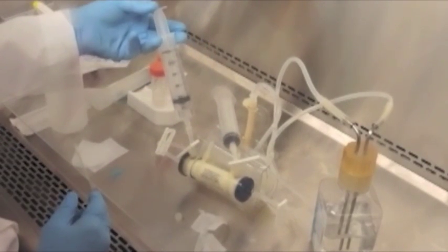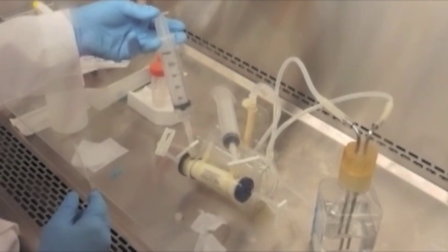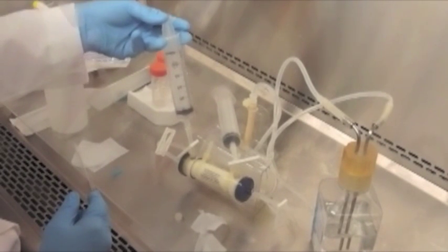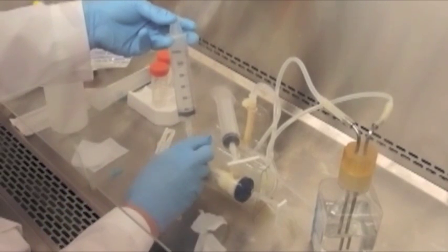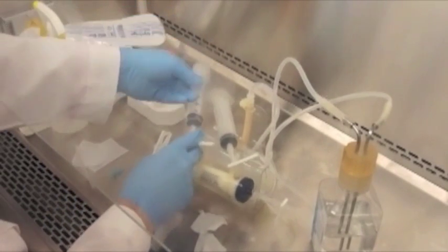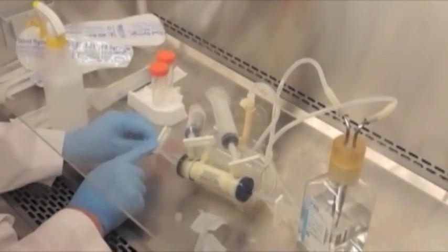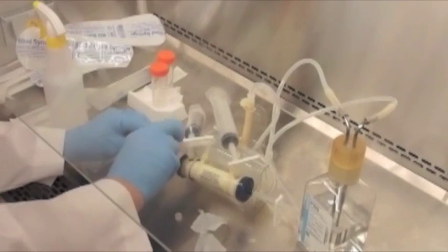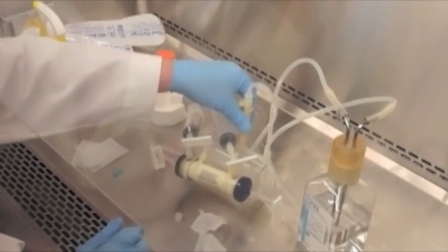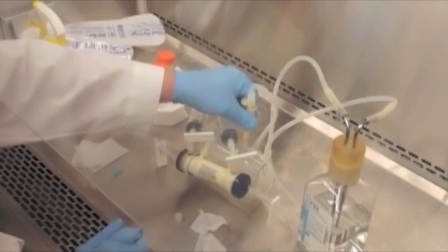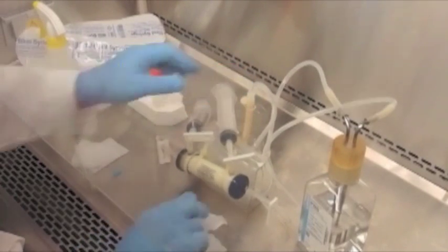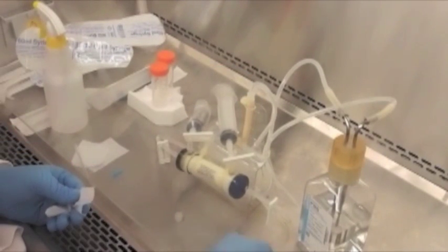Be sure to refer to the FiberCell quick start guide and the manual for complete directions as to how to perform the pre-culture. We'll want a minimum of 24 hours with the PBS, a minimum of 24 hours with basal media, and then a minimum of 24 hours with complete media prior to cell inoculation. And it's quite important to not forget to open up the left hand end port slide clamp. This is usually the last maneuver that's performed, and sometimes it's easy to forget it.